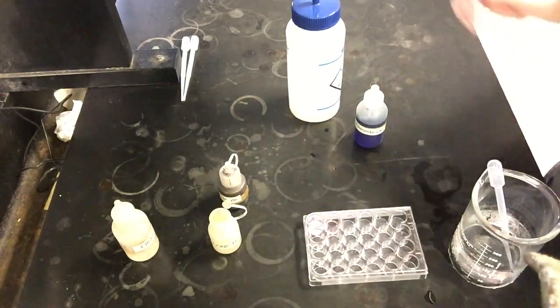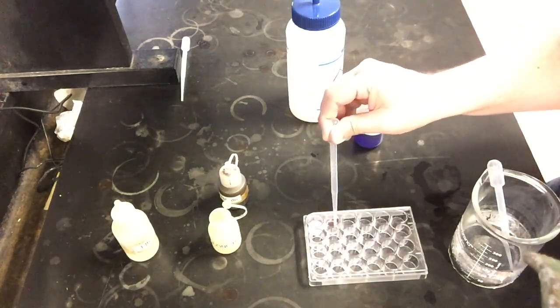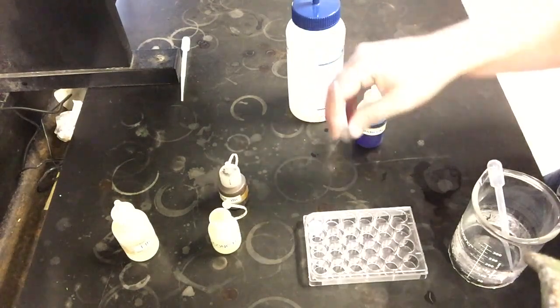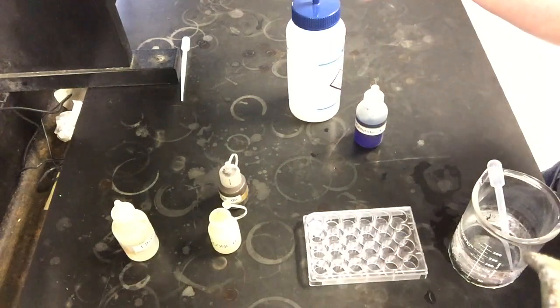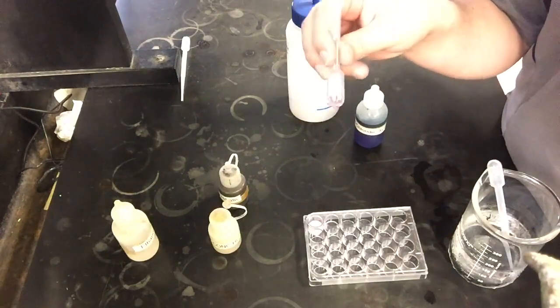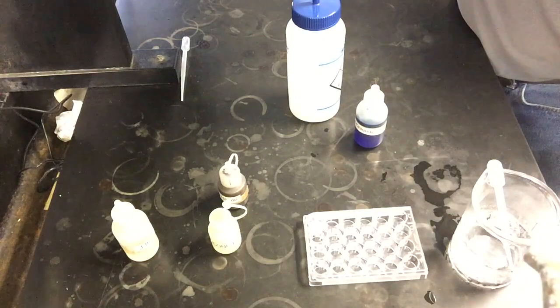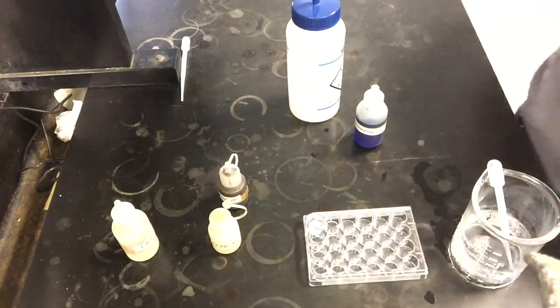Now, the last thing I want to do, similar to what I've done in the other ones, is take a look at temperature effects. So I'm going to go ahead and pull some of this up into a pipette. It's not a ton, but should hopefully be enough for us to see a color out of. Because we're really just looking, is it going to be kind of purple, or is it going to be blue? That should be noticeable, or is it going to be this light pink color still? So I'm going to heat this up real quick, and then we'll take a minute or two here to see what happens. And I'll have one that I'll put in an ice bath here as well, in a cold temperature, for the comparison.